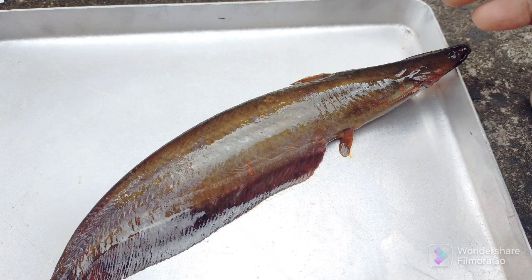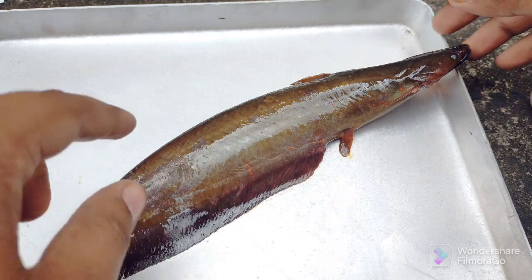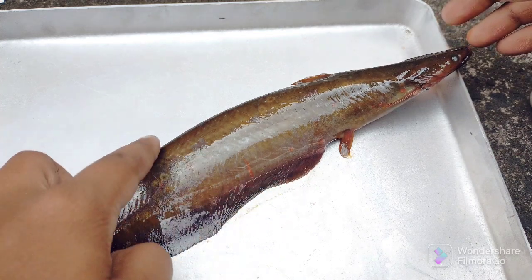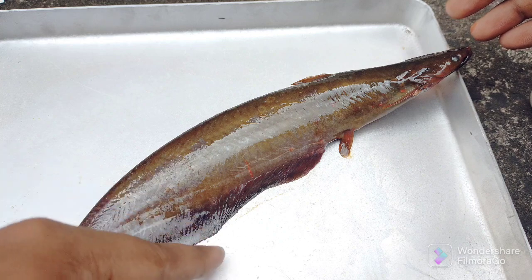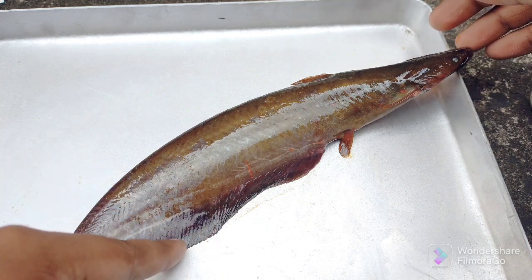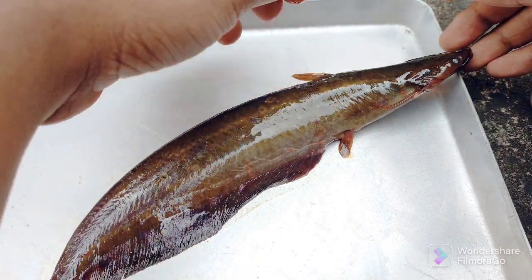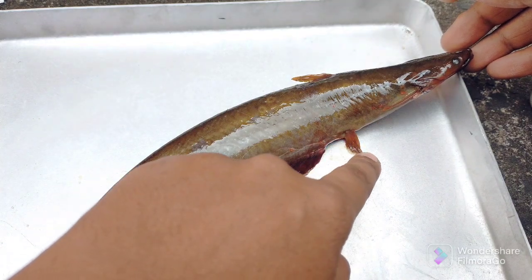It has a long anal fin, but does not have a long dorsal fin. It only has a small dorsal fin and also a small ventral fin.